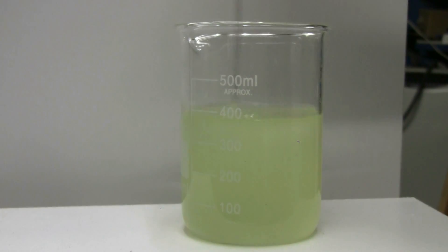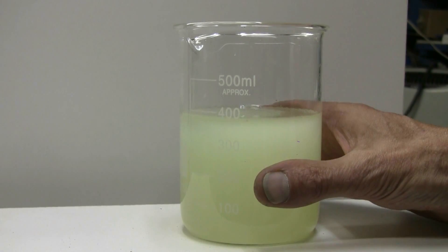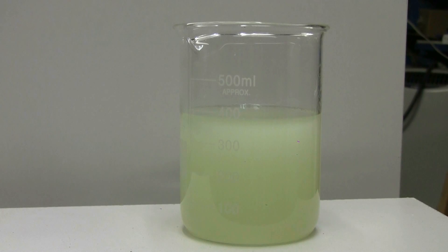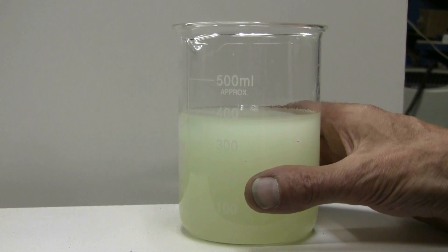As we can see, stir it in, it turns cloudy. The beaker is warming up. Both solutions were at about 60 degrees Fahrenheit when I started. This is warming up quite nicely.